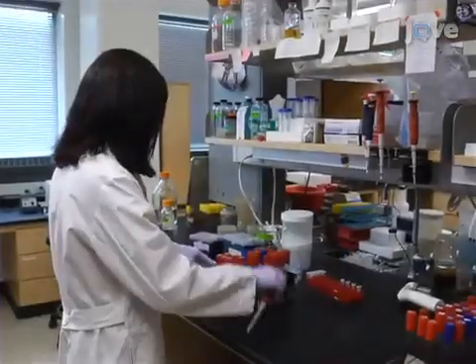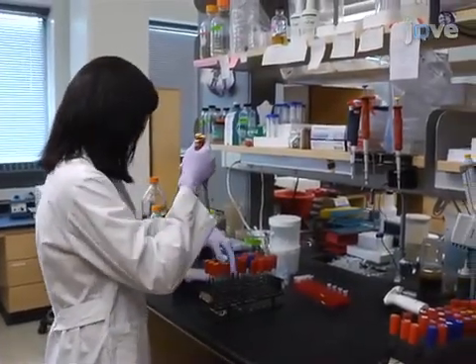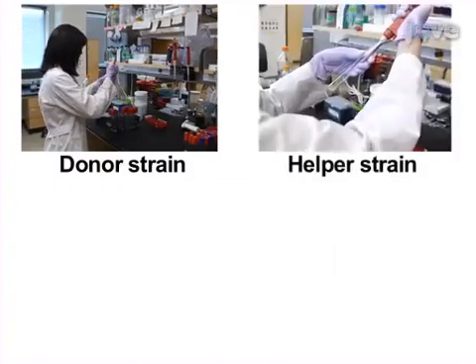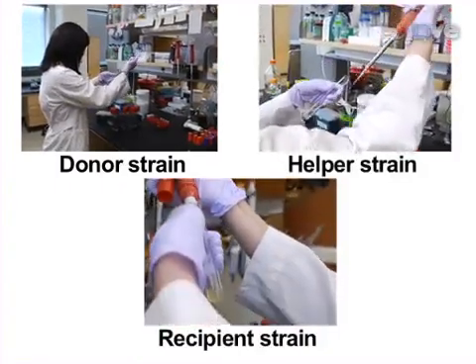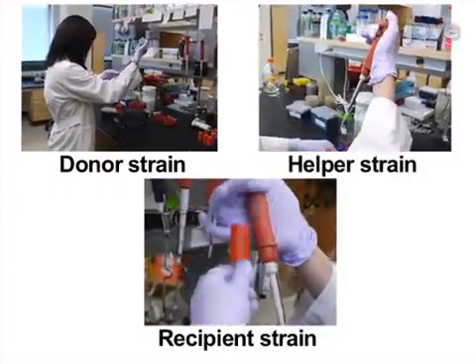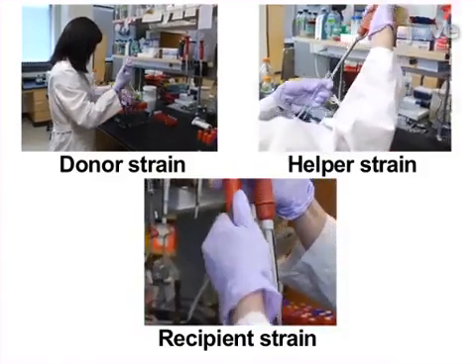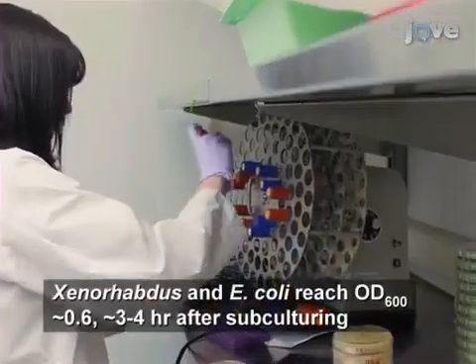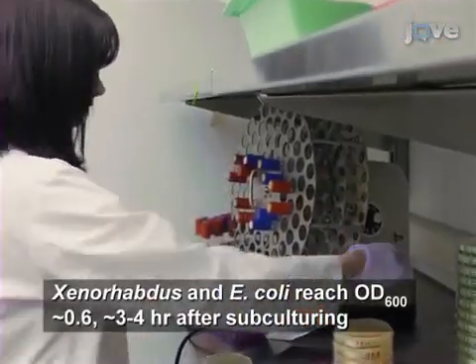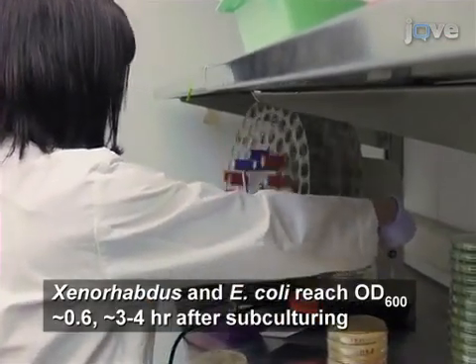After overnight growth of the bacterial strains, subculture the donor, recipient, and helper strains into nutrient-rich growth media lacking antibiotics in a 1 to 100 ratio of culture to medium. Then grow the cultures at the temperature appropriate for each strain until they reach mid-log stage growth.